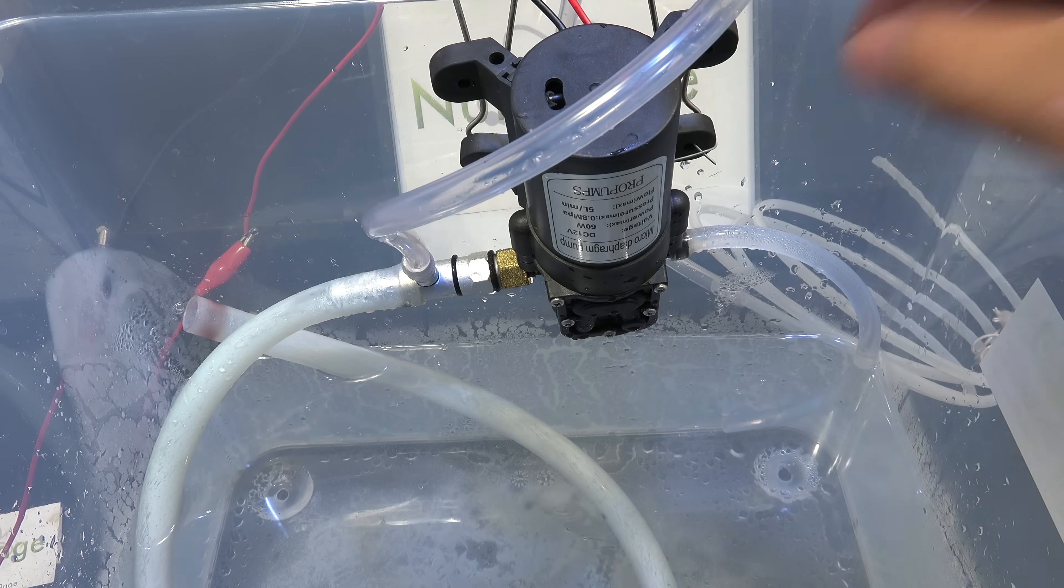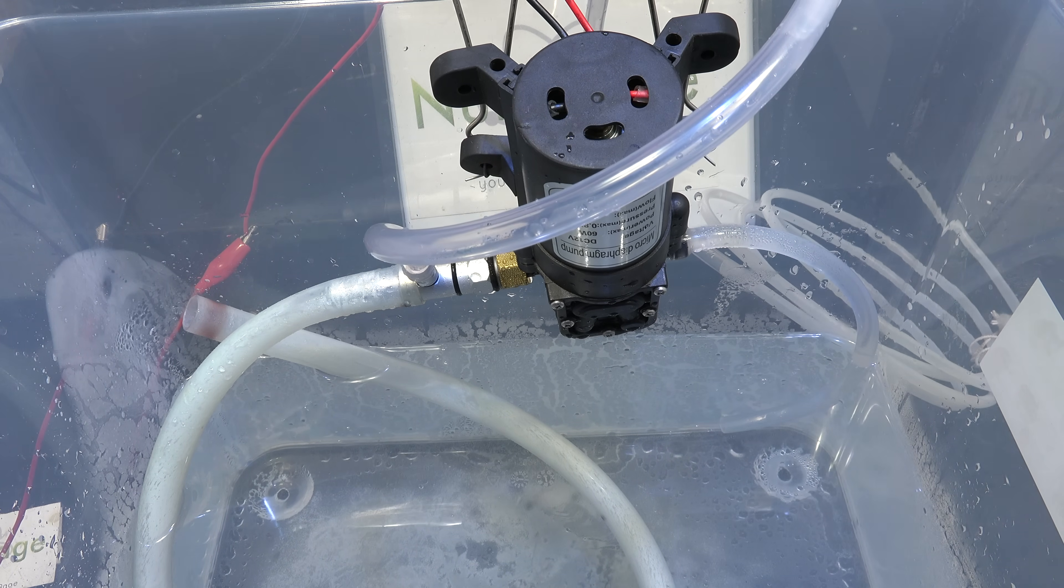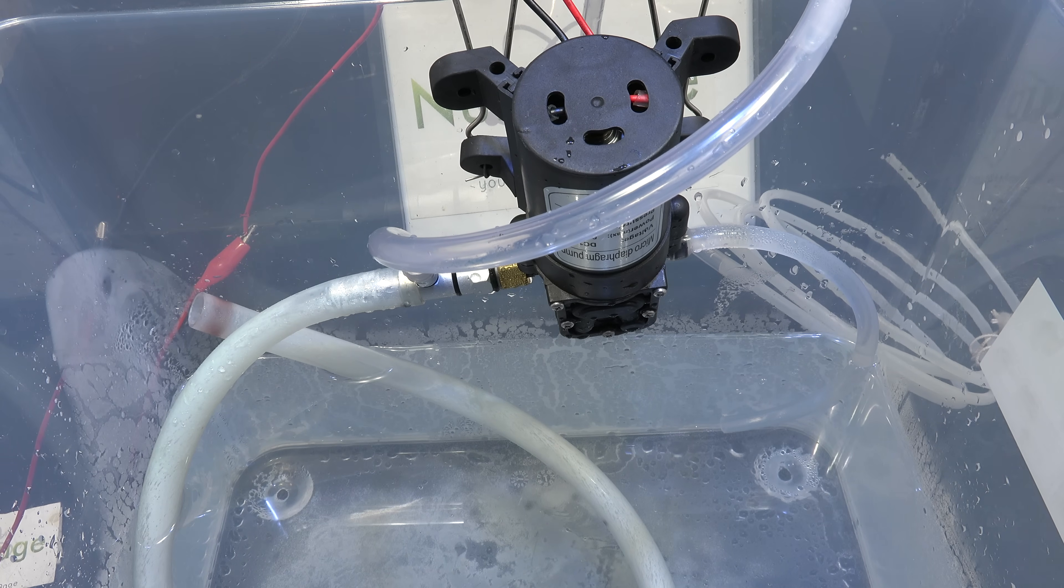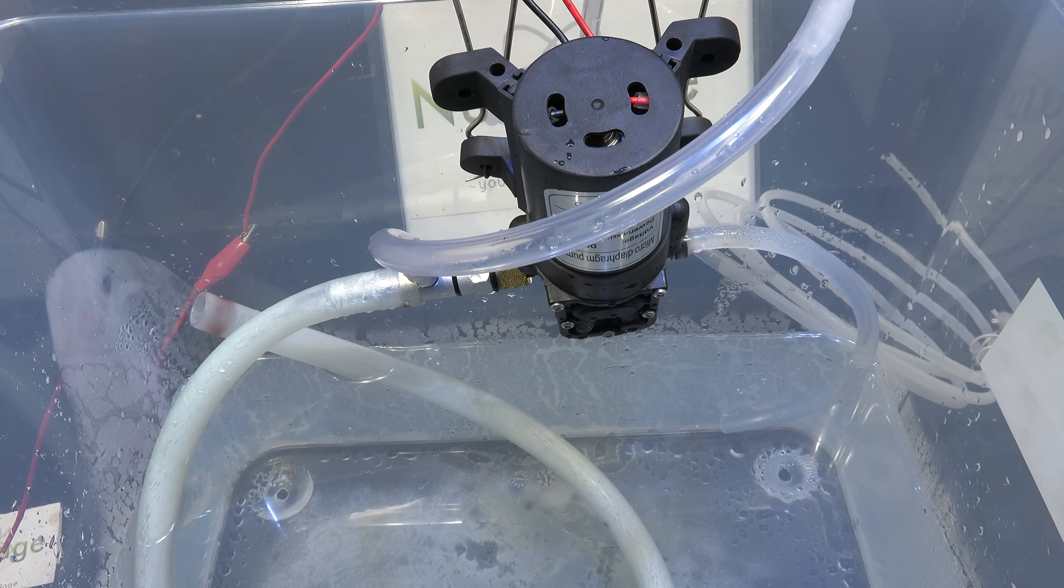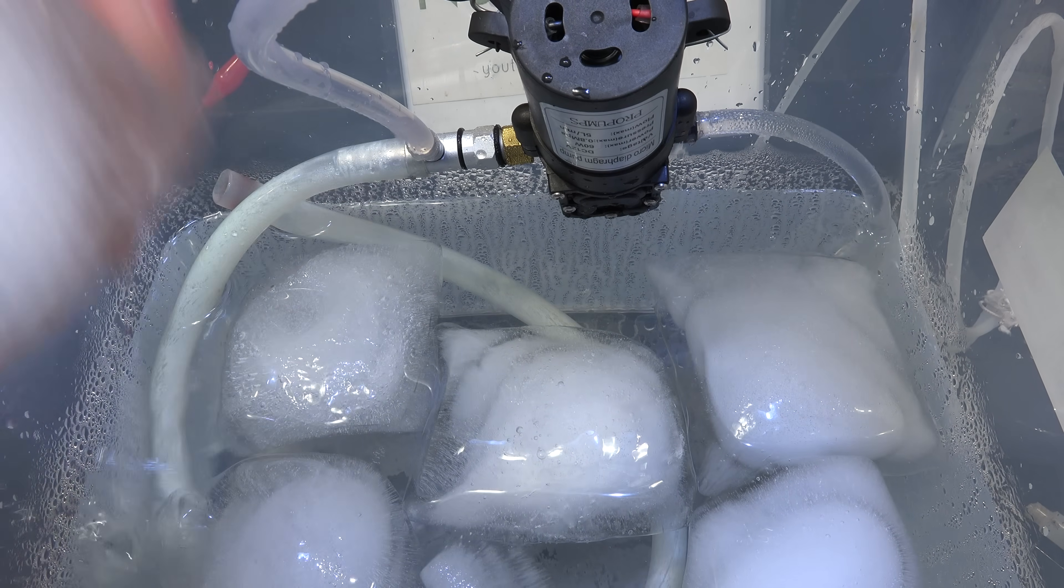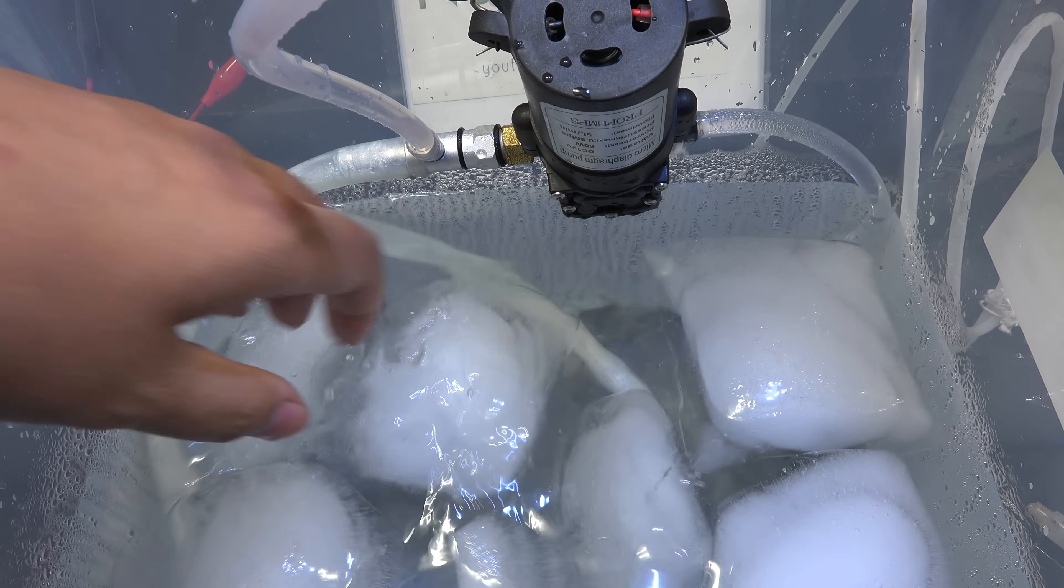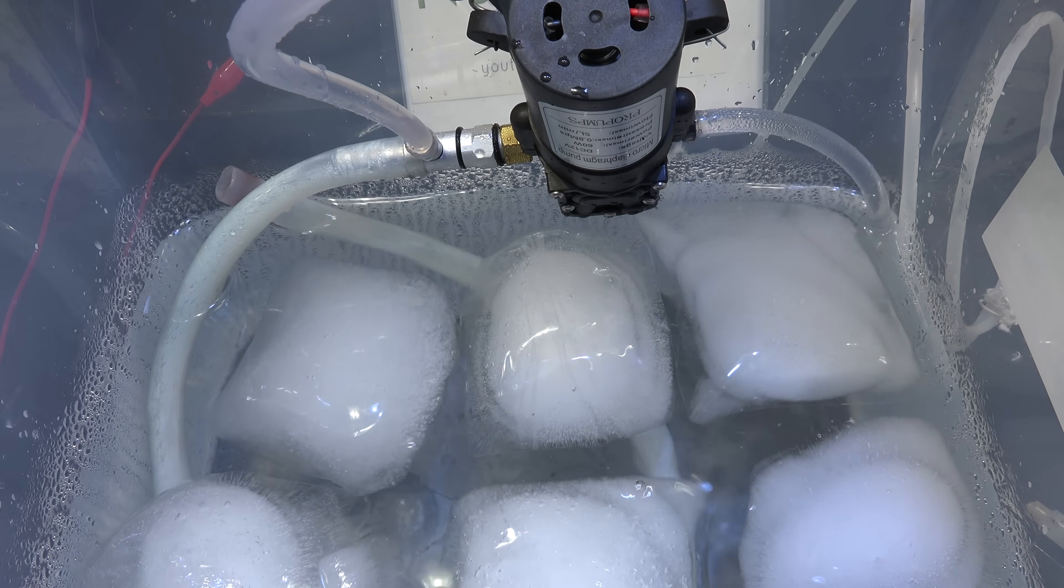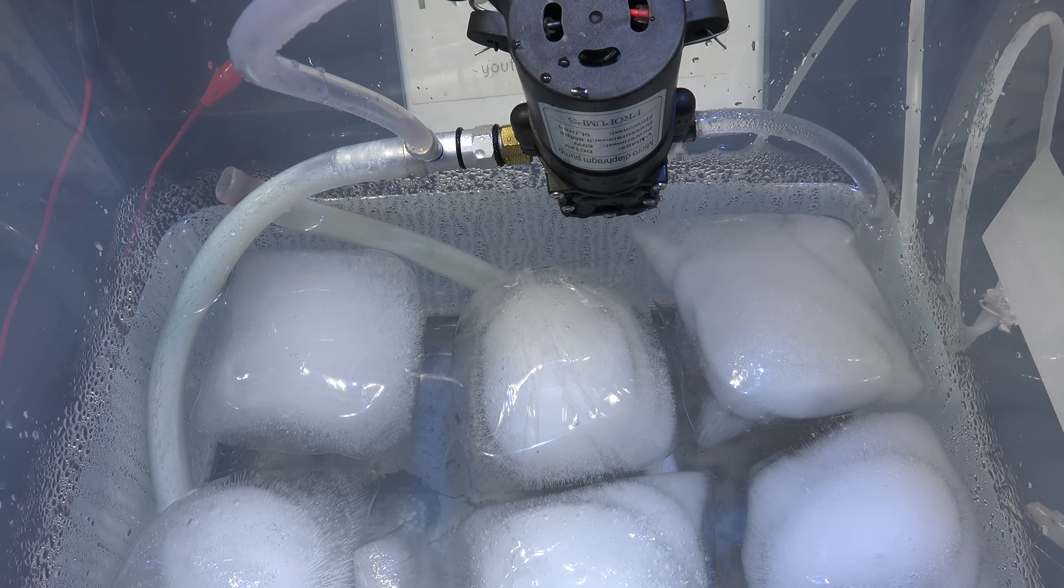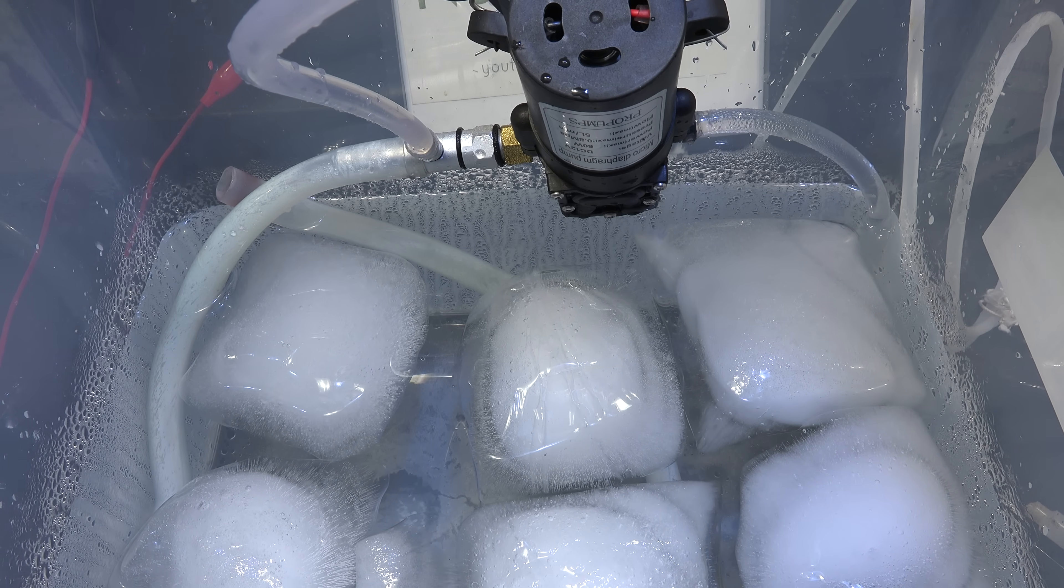Now I'm not going to replace my reservoir with oil or ethylene glycol because those are not nearly as cheap and they're quite messy. There is however one simple trick for getting even better vapor pressure just with water. We add lots of ice. By lowering the temperature we lower the vapor pressure of the water. Granted it's only temporary until the ice melts. But if you have enough ice it can last you a distillation run. Let's give it a try.